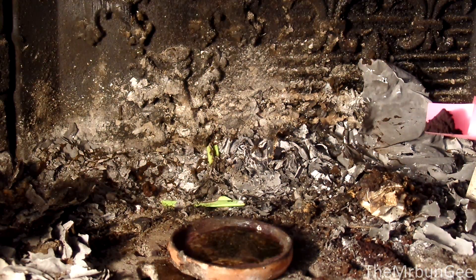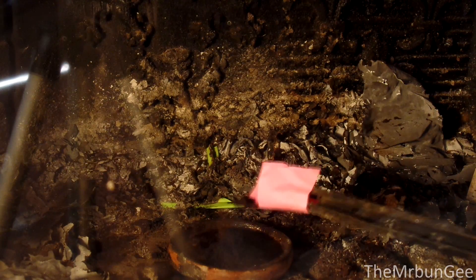This time I will experiment with the oxidizing properties of manganese heptoxide. YouTube is full of videos of it oxidizing alcohols and other things, but I'm going to show you how it reacts with some metals, paraffin, and the most interesting one — hexamine.